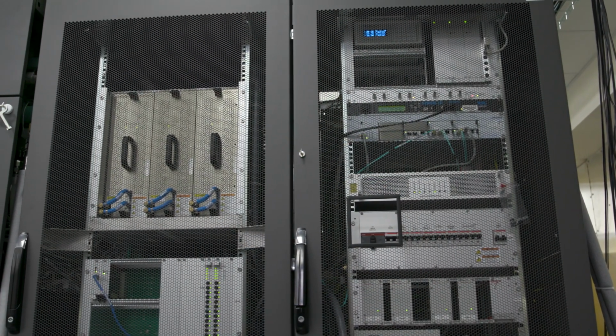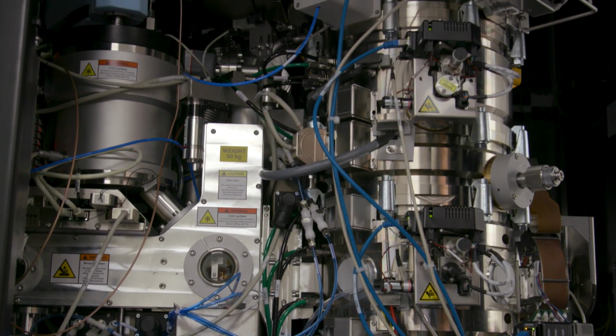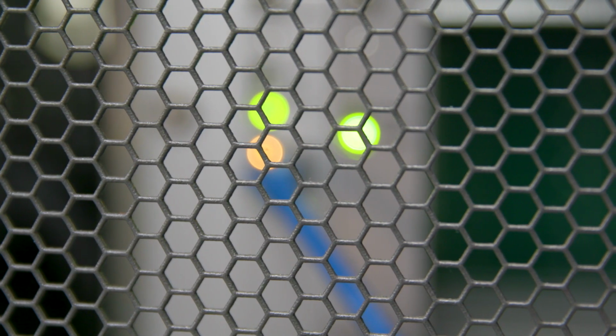New tools and new techniques let us ask new questions. We can go deeper into a problem because we have technology that lets us, for instance, in this case, visualize something we couldn't visualize before. Or they make a process that was very difficult and time-consuming much easier and quicker, so we can progress quicker in our understanding of a given biological problem.